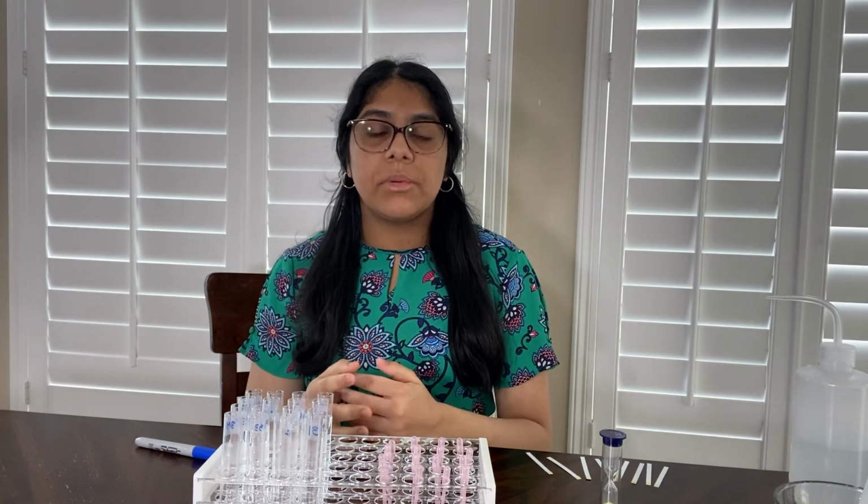So now I'm going to be demonstrating the row column method, and it's going to be a little bit different than how I showed the Dorfman and the binary method because instead of just 8 individual samples, I'm actually using 16, and I've arranged these 16 samples in a 4x4 array.